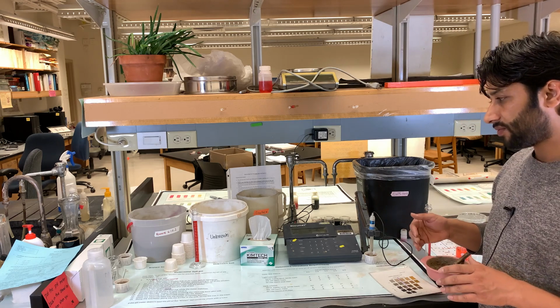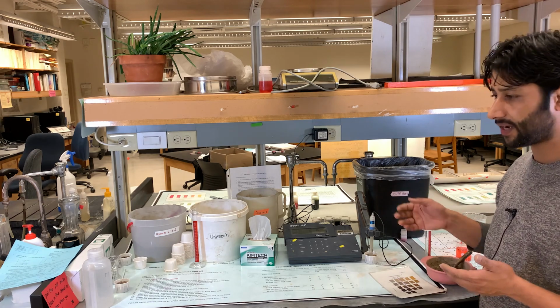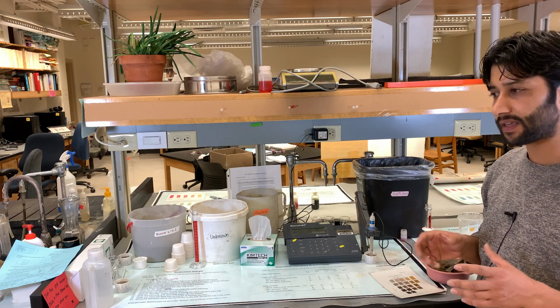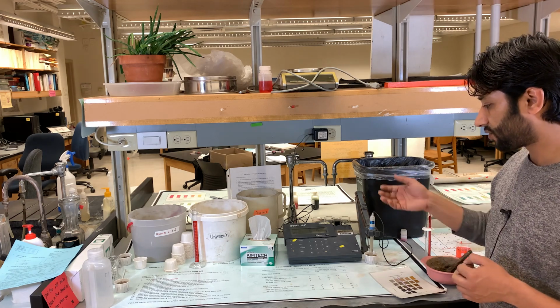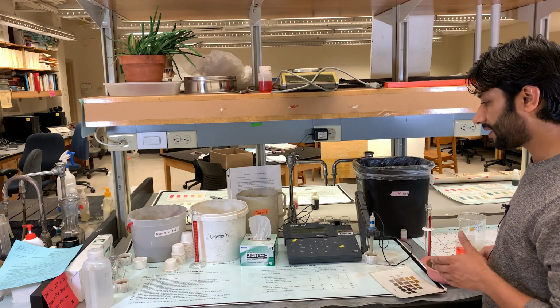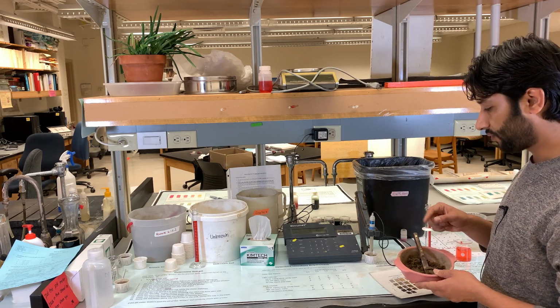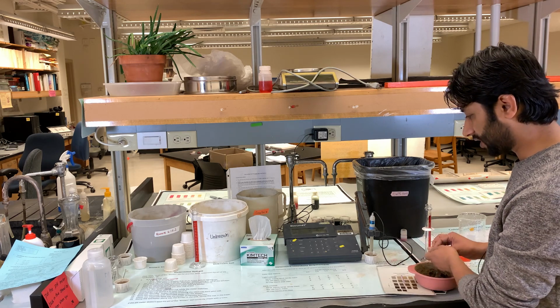But this time we also add one more thing. If the goal is to increase the pH of a soil from 5.9 to 6.5, which is basically the neutral pH area where most of the nutrients will be available to the plants, in that case, we need to add lime to increase the pH of the soil. But before we determine the amount of lime, we need to determine the texture of the soil and also determine the color of the soil. So based on those two pieces of information and the pH, we should be able to determine how much lime we need to add to raise the pH of the soil to 6.5.